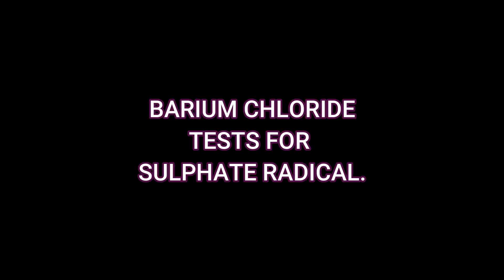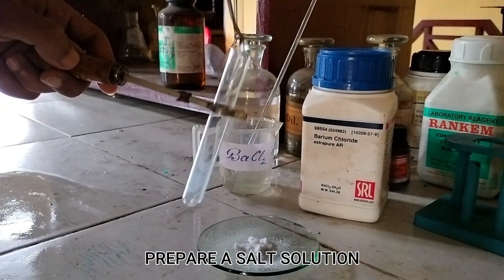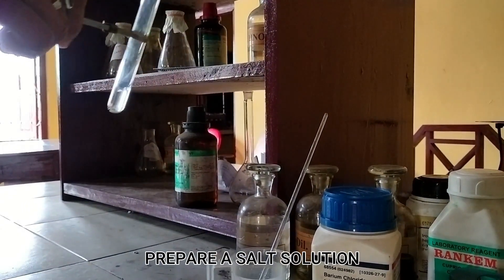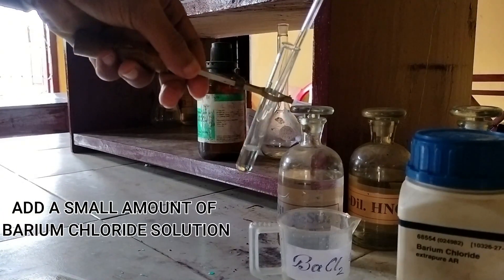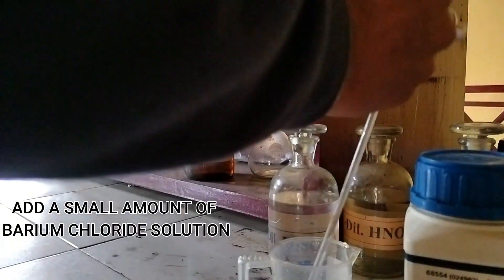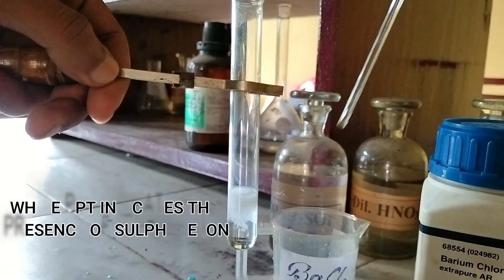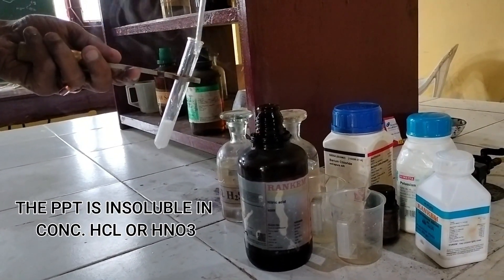Now we move to wet tests, which are performed using a salt solution. For the wet test for sulfate, the chemicals required are barium chloride solution and concentrated nitric or hydrochloric acid. Take a small amount of salt in a test tube and prepare a solution, then add a few drops of barium chloride solution. A white precipitate appears, indicating the presence of sulfate ion. The precipitate is insoluble in concentrated hydrochloric or nitric acid.